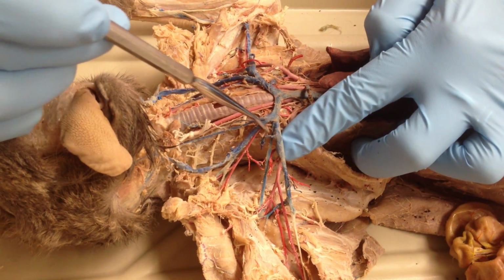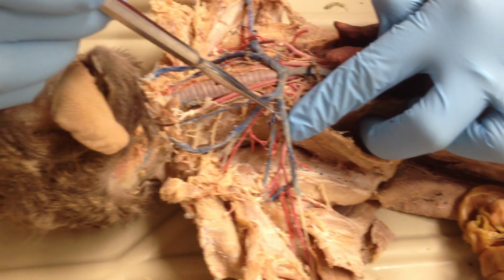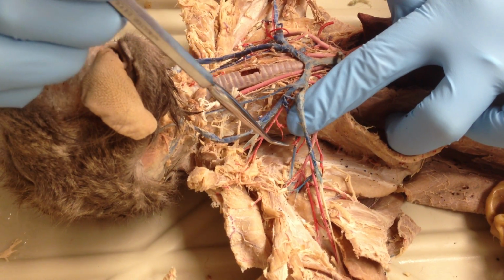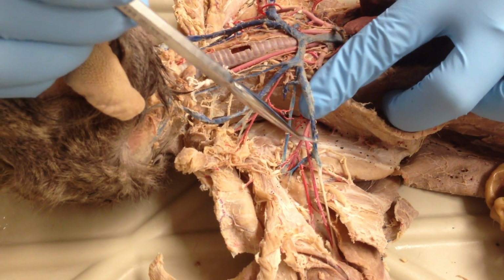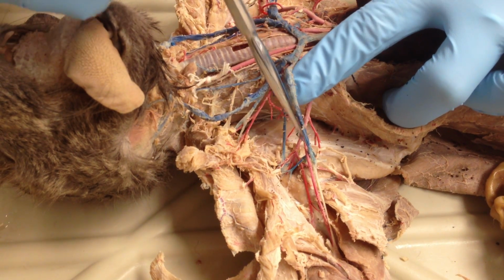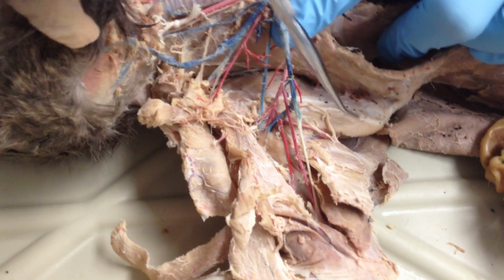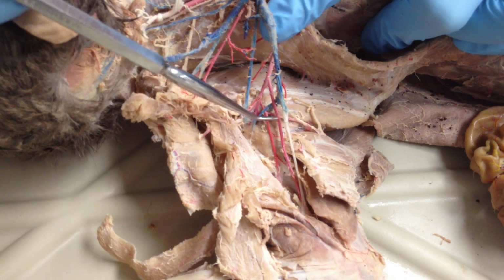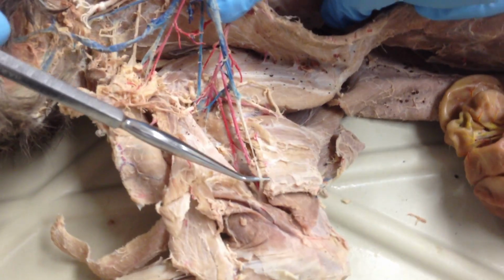The axillary has coming off of it 3 nubs. The first one is the V, ventral thoracic. The L, which is the long thoracic, which is probably this guy, potentially. It's kind of hard to tell. And the last one would be thoracodorsal, coming back towards the latissimus dorsi. Once you have your last branch, the VLT, then you have brachial for your vein. Axillary, then brachial.